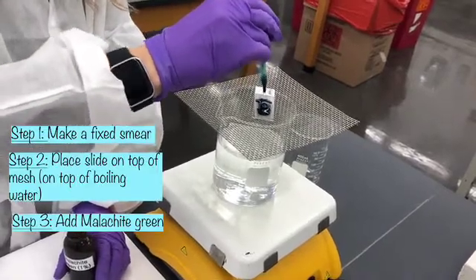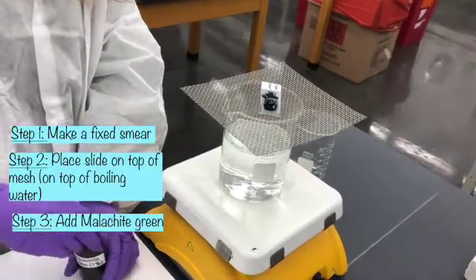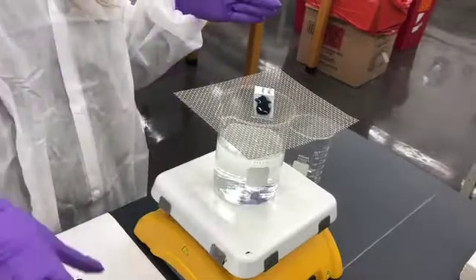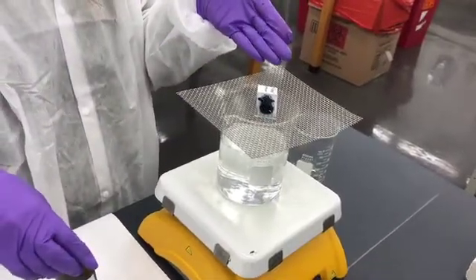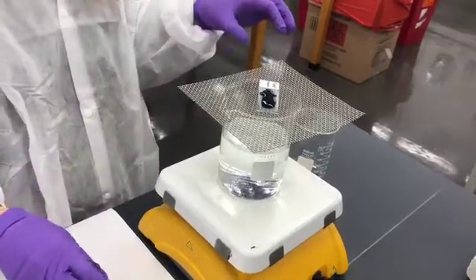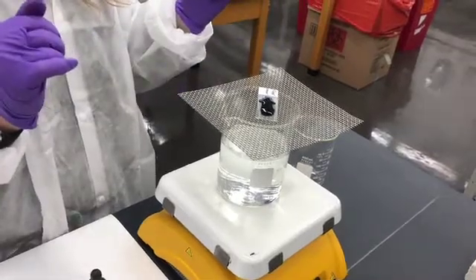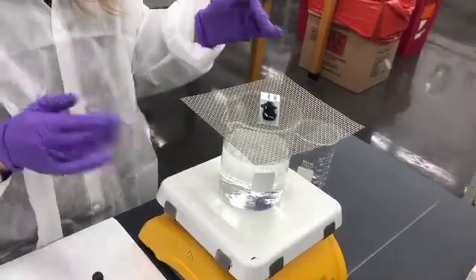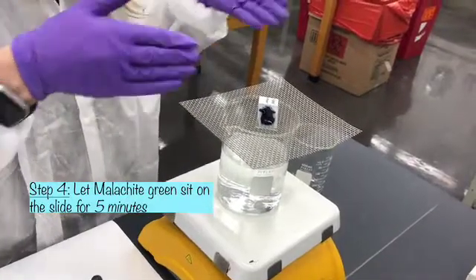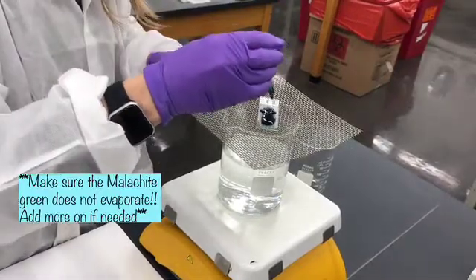But the important part of this step is that we want to apply high heat, steam heat. We do not want the thick smear to dry out. We want the dye to be there for the duration of the time that we have the slide in the steam heat, which is 5 minutes. So you have the option of sitting here and watching it and making sure that it doesn't evaporate. If it needs another drop of dye, you can add another drop of dye.